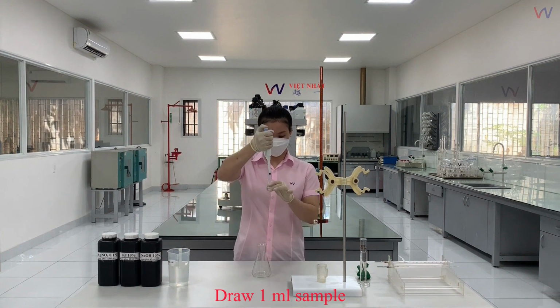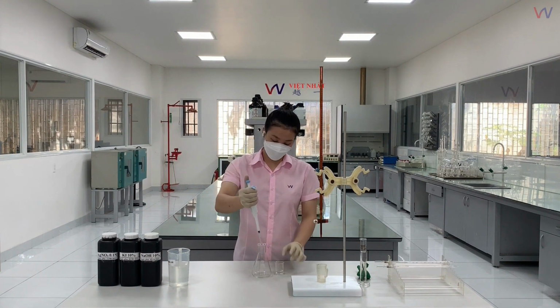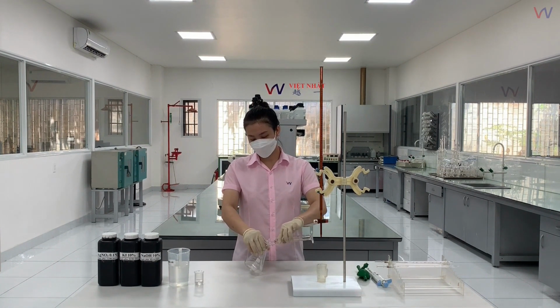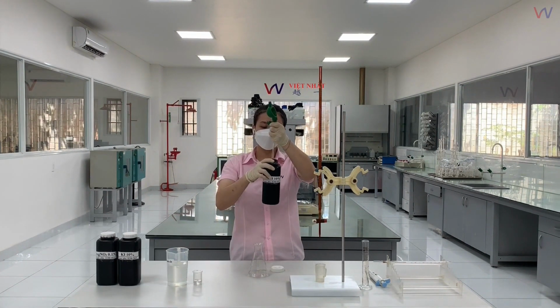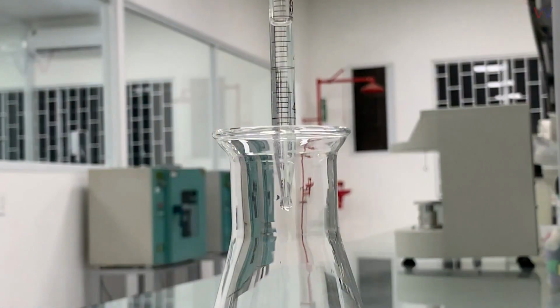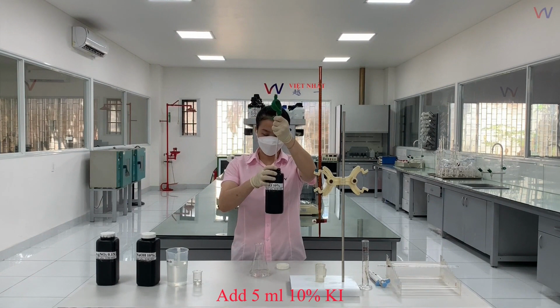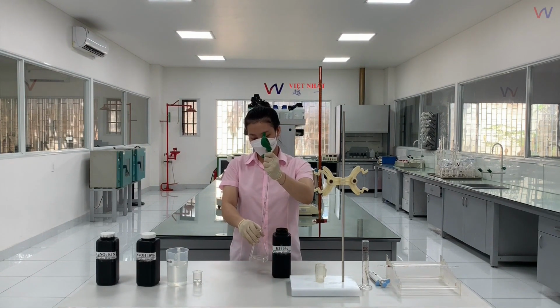Draw 1 ml of the sample into the Erlenmeyer flask. Add 50 ml of distilled water to the Erlenmeyer flask, then shake the solution well. Using the measuring pipette, draw 5 ml of 10% sodium hydroxide solution and add it into the Erlenmeyer flask. Shake the solution well. Next, add 5 ml of 10% potassium iodide solution and mix the solution well.